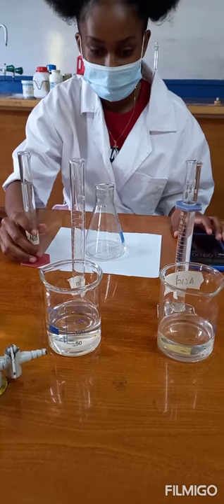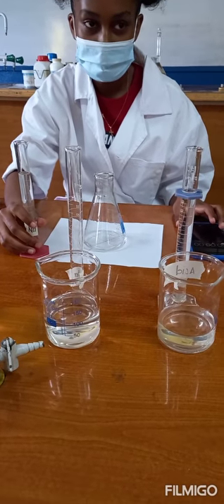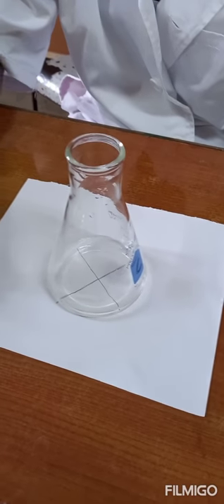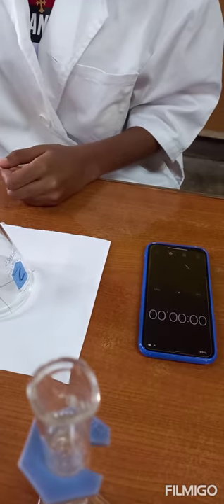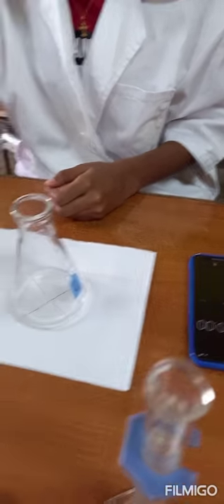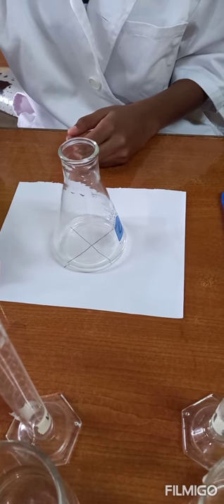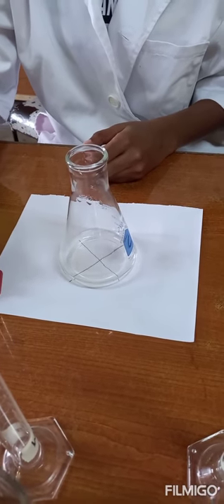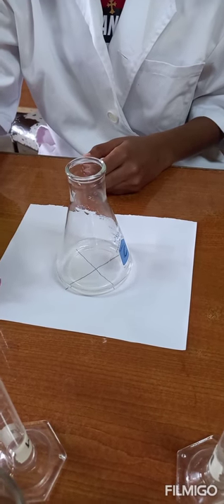The student is going to swirl the conical flask until the solution gets opaque. If you notice, there is an X underneath. When the X is no longer visible, we use the timer to time the reaction, and when you cannot see the X through the conical flask we are going to stop the timer.